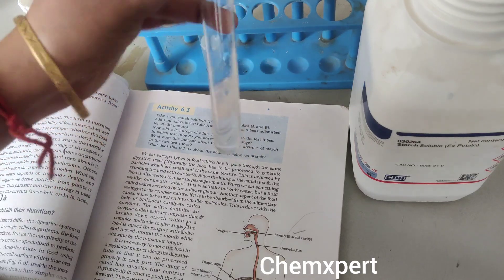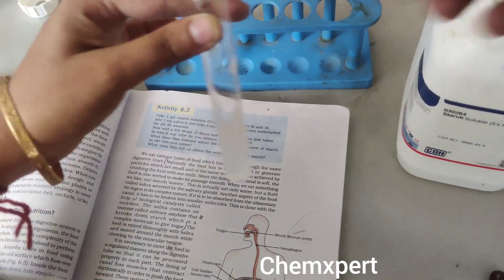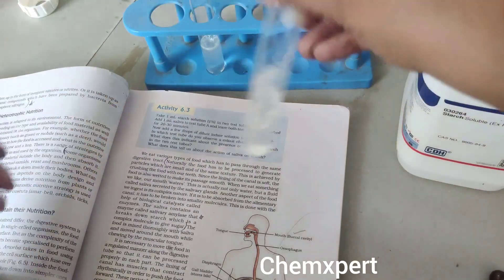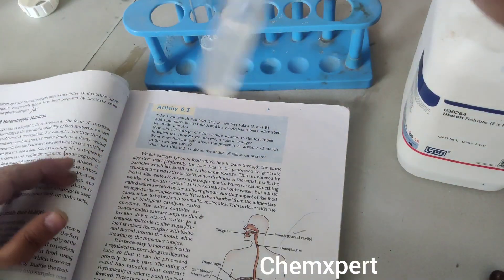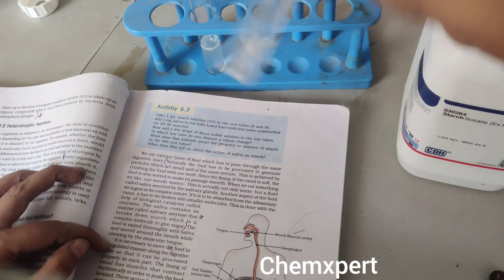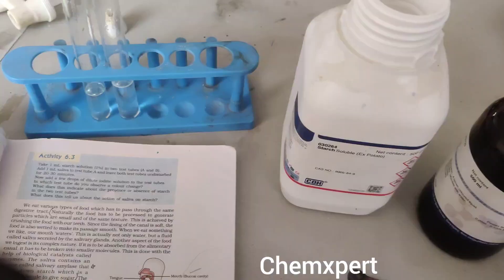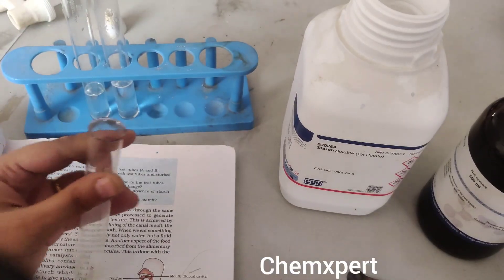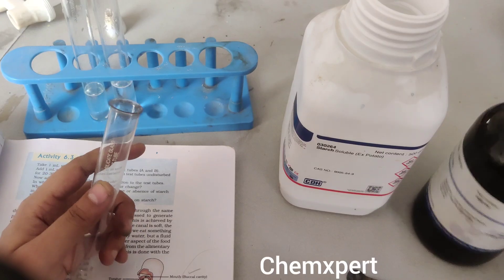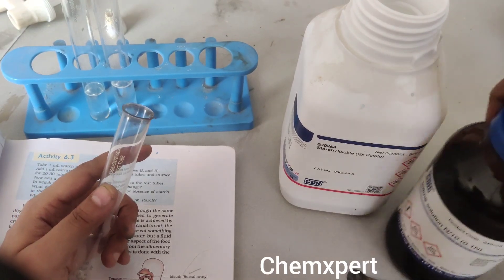The first step of the activity is to add starch into water and prepare the starch solution. One is test tube A and another one is test tube B.